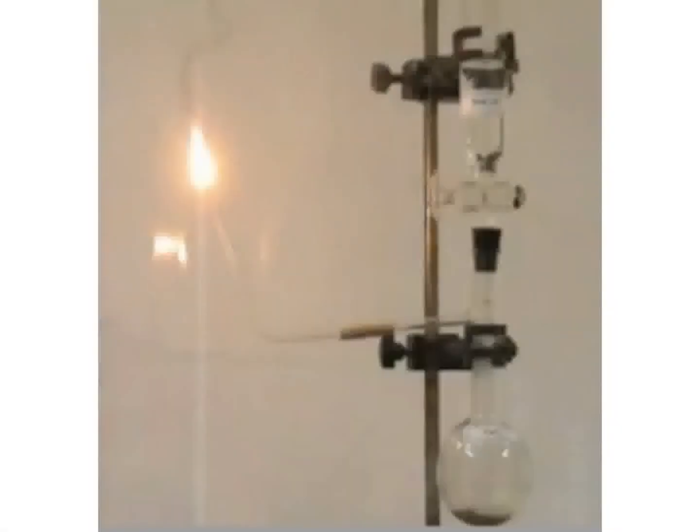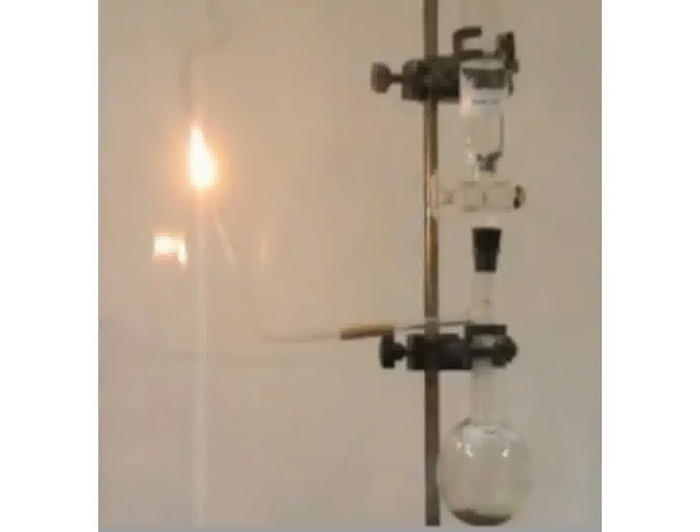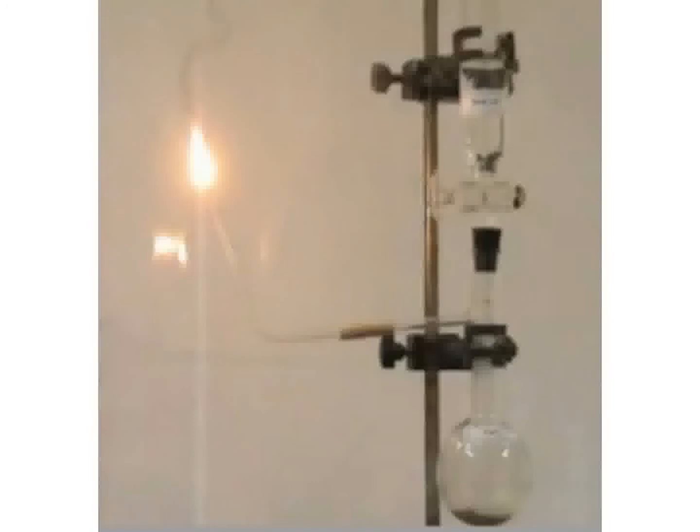Acetylene gas C2H2 burns with oxygen in an oxy-acetylene torch to produce carbon dioxide, water vapor, and the great heat needed for welding metals.